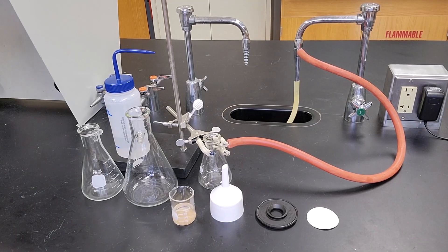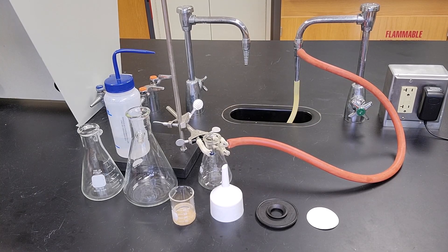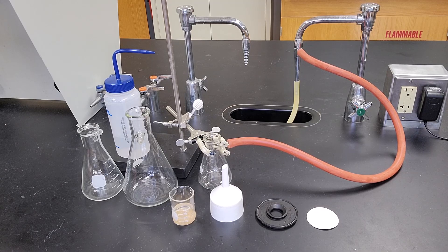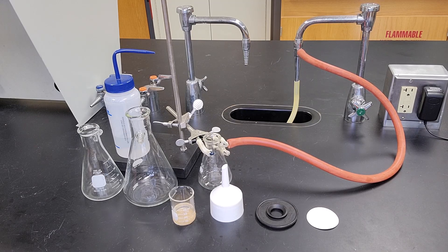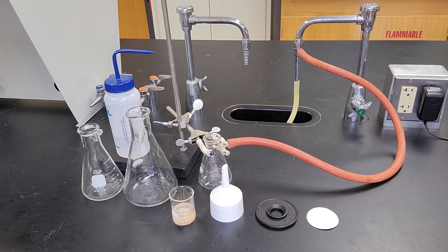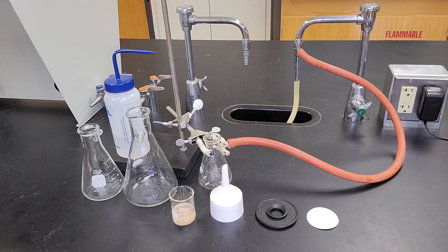In this video, I'm going to show you how to do a vacuum filtration using a Buchner funnel. Vacuum filtration is a very useful skill if we're trying to separate a solid from a solution or liquid.